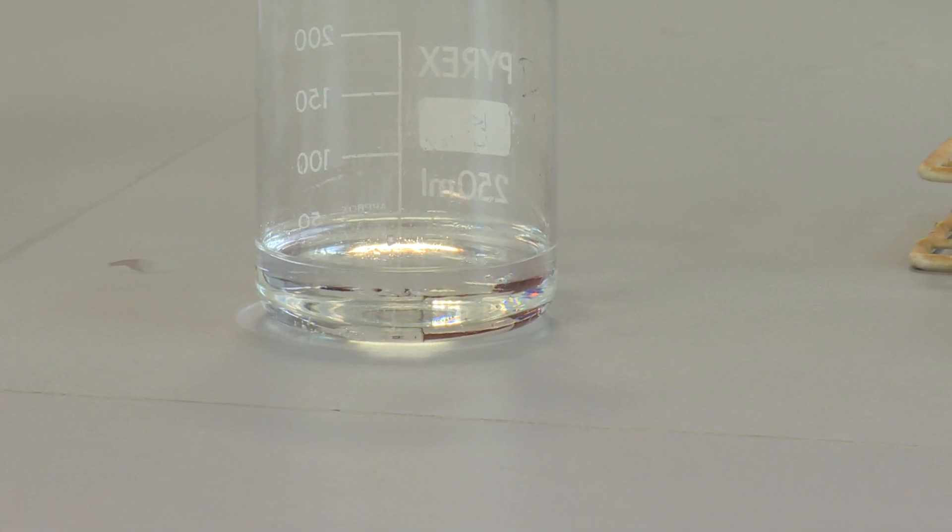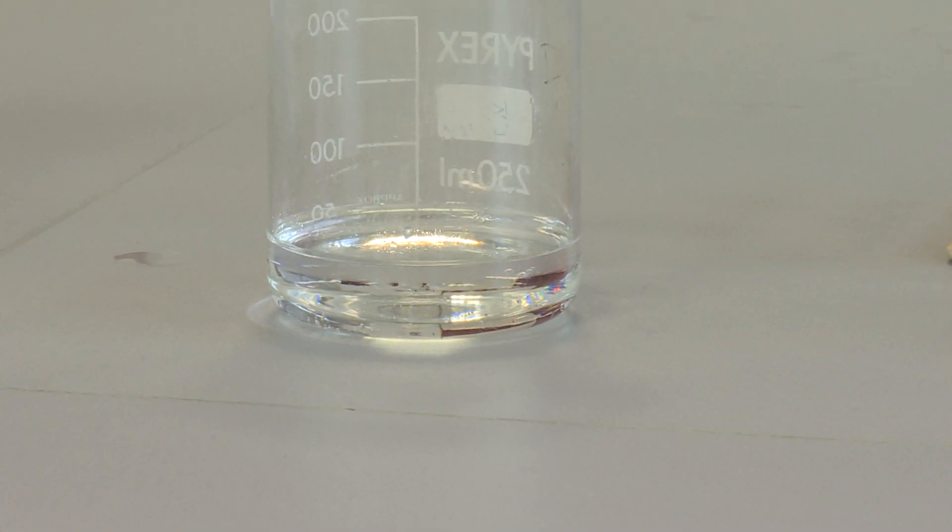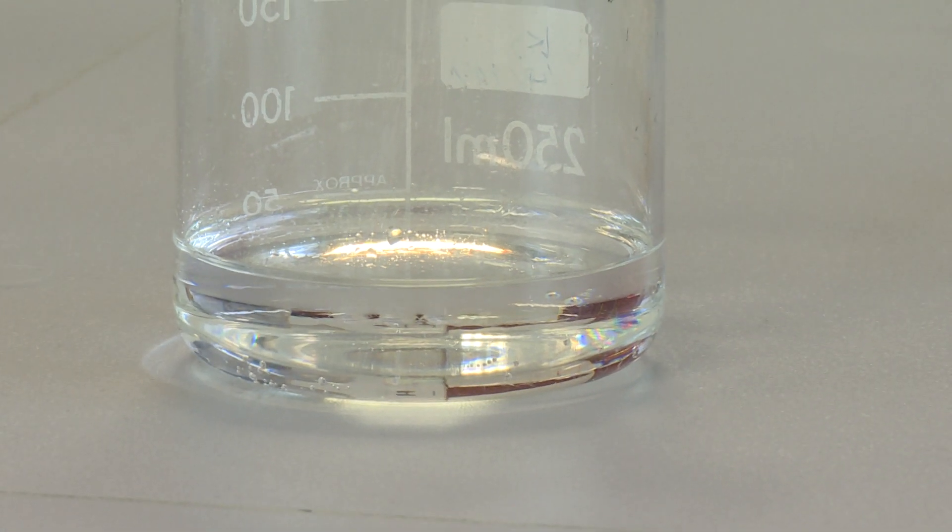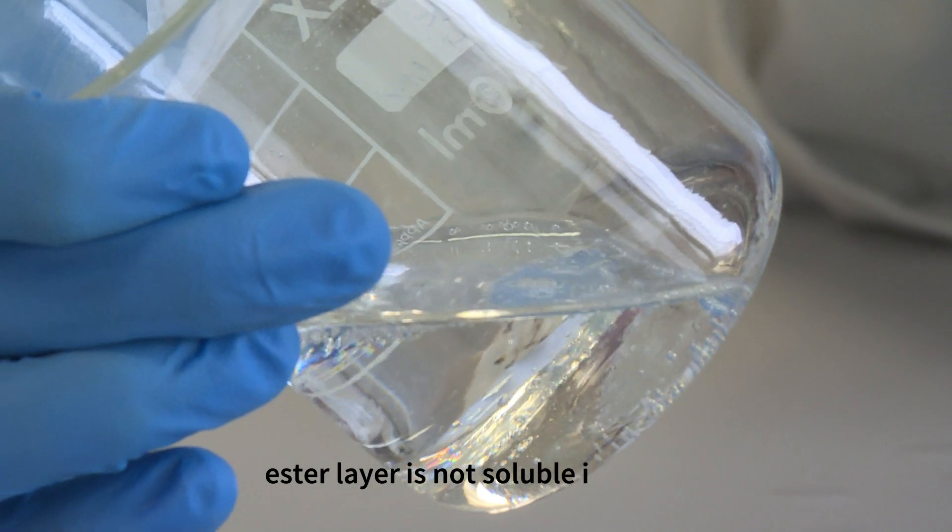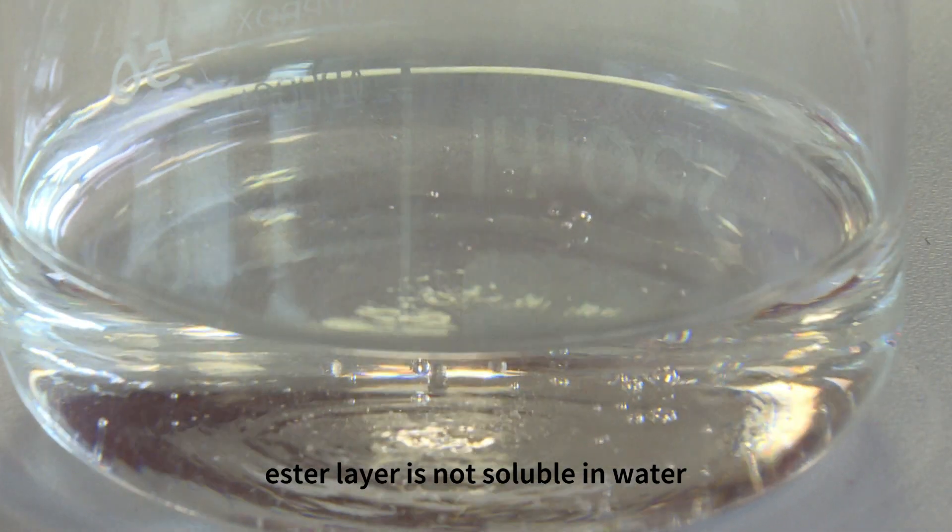You have to look closely to see the top layer. Esters are immiscible in aqueous solution, so the ester will be forming a very thin layer that you can see on the top.